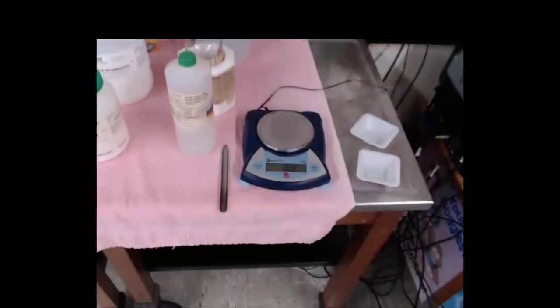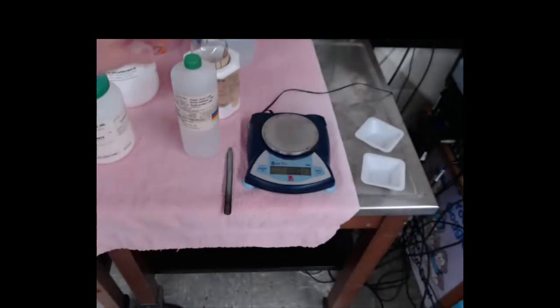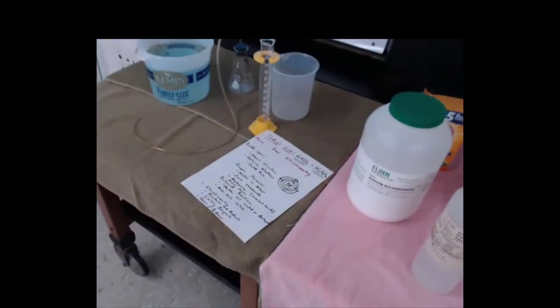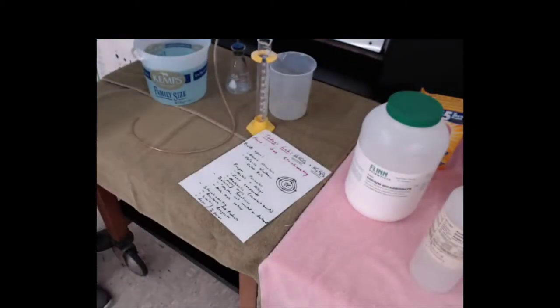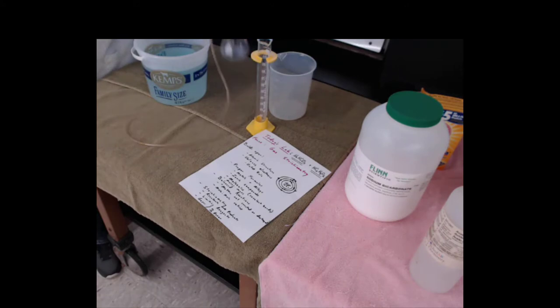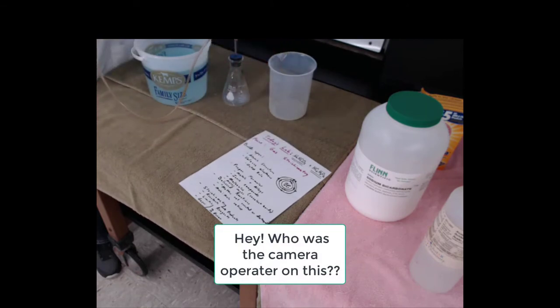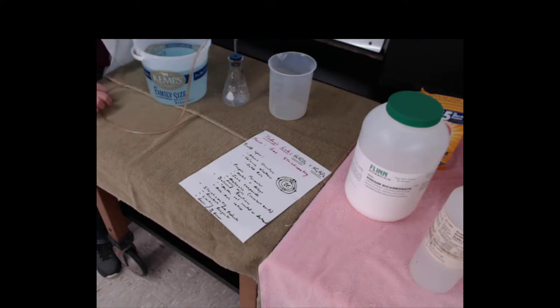So we're going to need a balance, acetic acid, and sodium bicarbonate, also known as sodium hydrogen carbonate, NaHCO3. We will be using a volume measuring apparatus. This will be our reaction vessel. We'll put our two chemicals in this. We're going to make a gas, and the gas will go through the tube, and we'll take our graduated cylinder, fill it up with water, put it upside down in here so it's full of water all the way to the top, and then we'll catch some gas as it bubbles up in there.